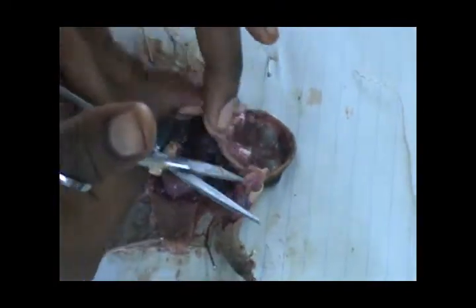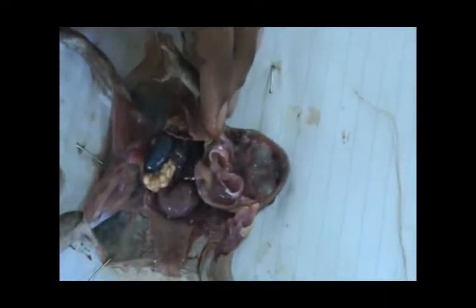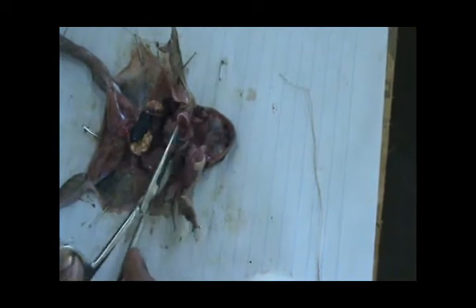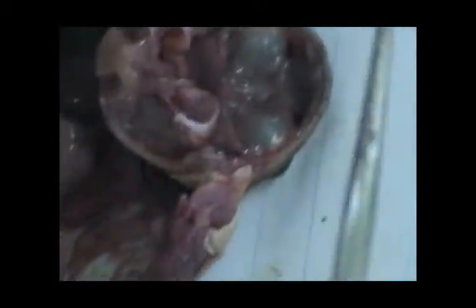The floor also has some blood vessels down here, mainly for gaseous exchange, because the frog uses its buccal cavity for gaseous exchange. When we go to the roof, the roof has the main features we really need in the dissection. The roof has these two holes which are almost at the lower surface.